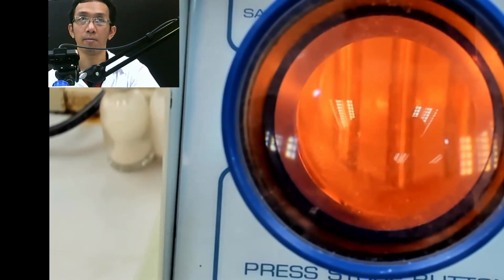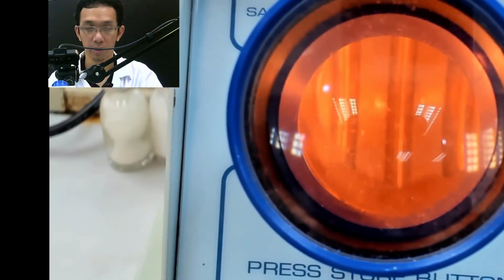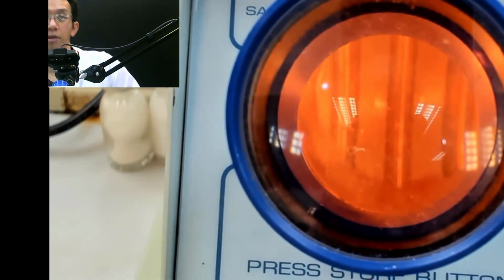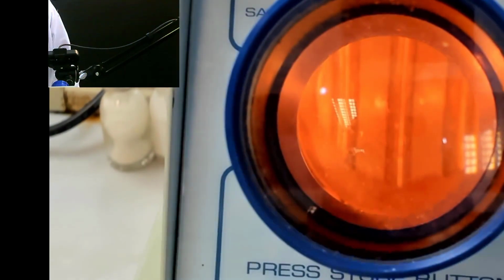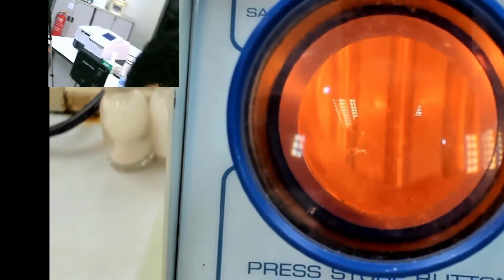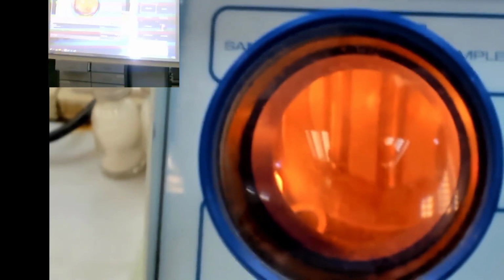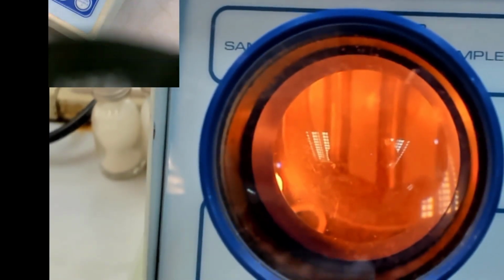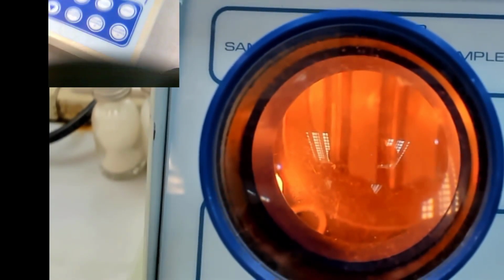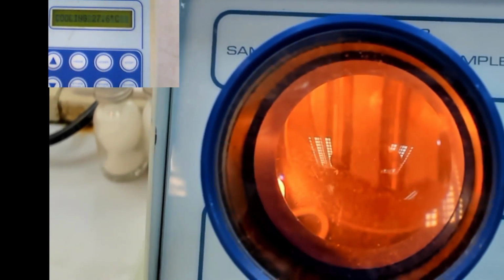And then I will take my camera over there and I will show the control panel, because you need the temperature also. Okay, so I will make this bigger. How to make it bigger?